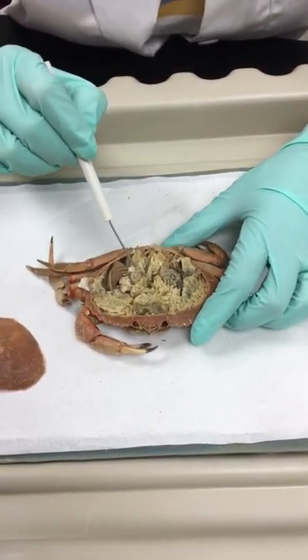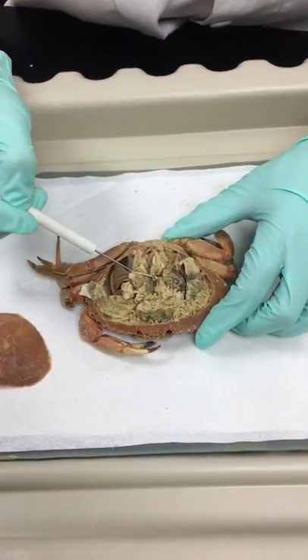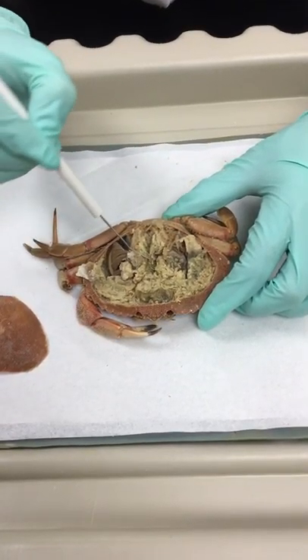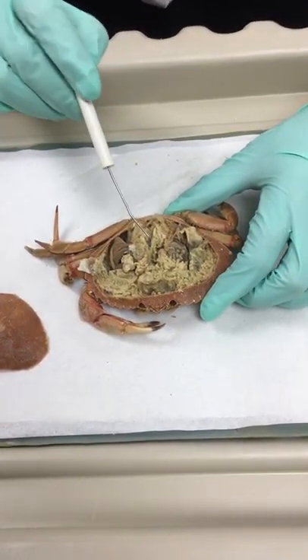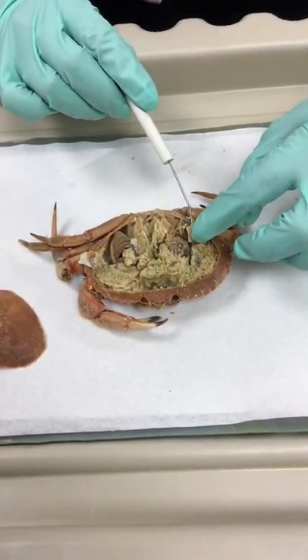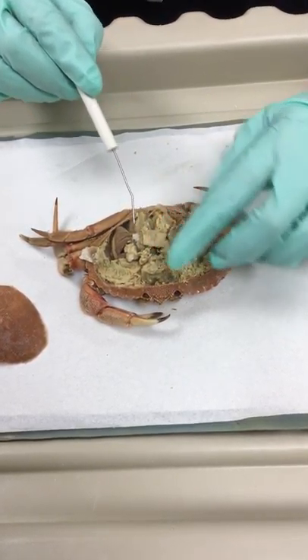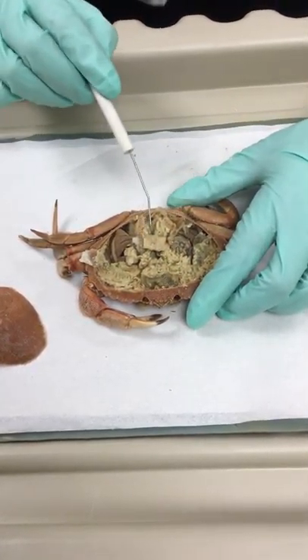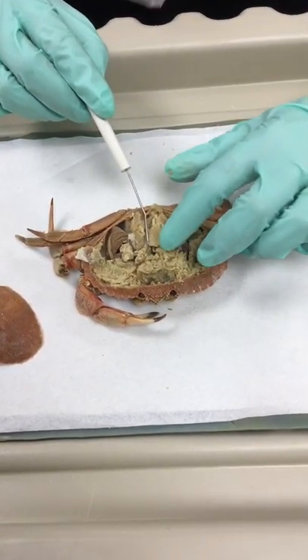If you can see down here, there's this little tiny tube — that is the midgut. And on top of that midgut is this structure, or was this structure. I lifted it up, and this is your heart.